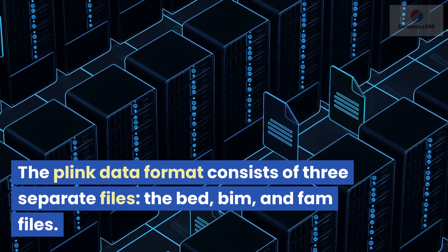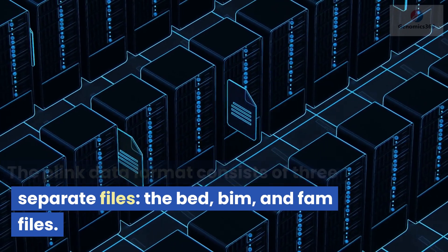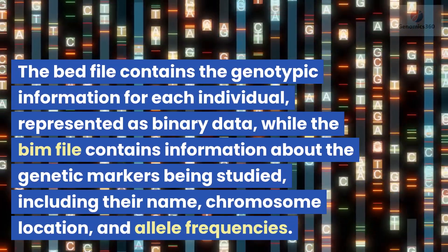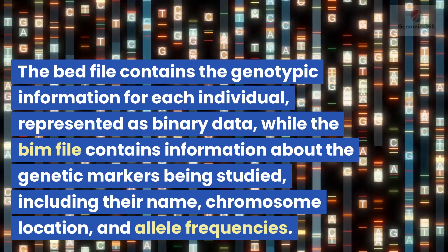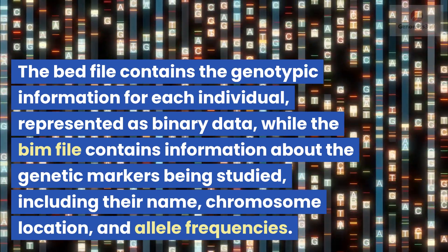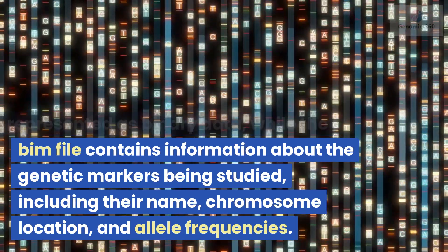The Plink Data Format consists of three separate files: the BED, BIM, and FAM files. The BED file contains the genotypic information for each individual, represented as binary data, while the BIM file contains information about the genetic markers being studied.